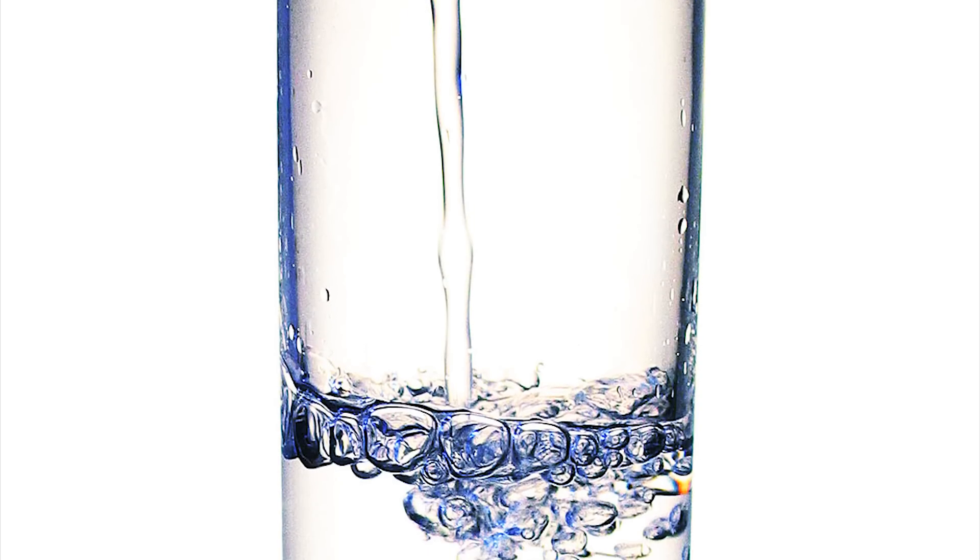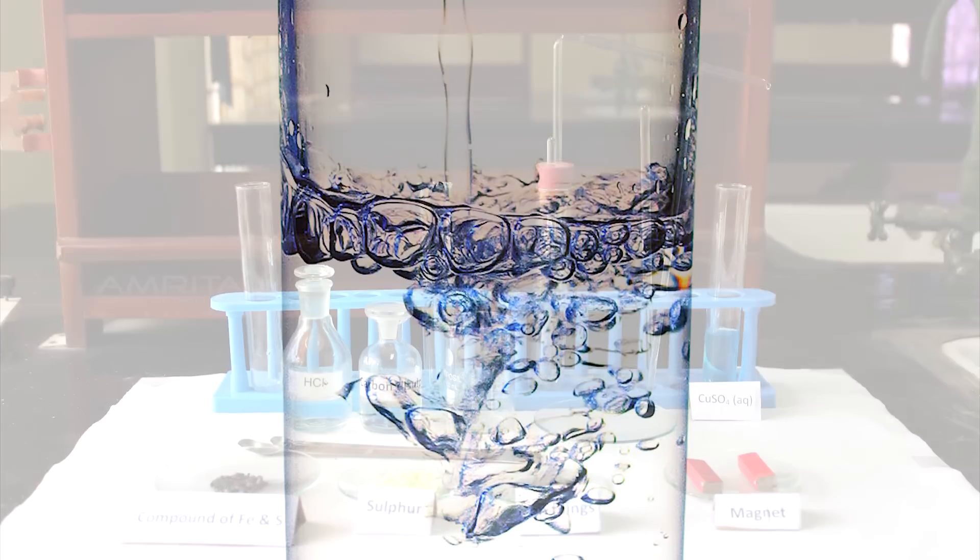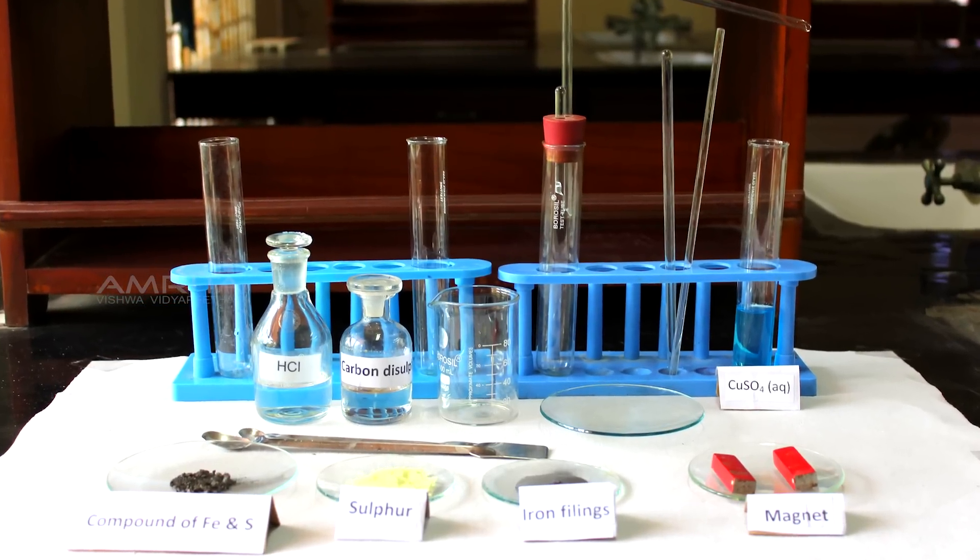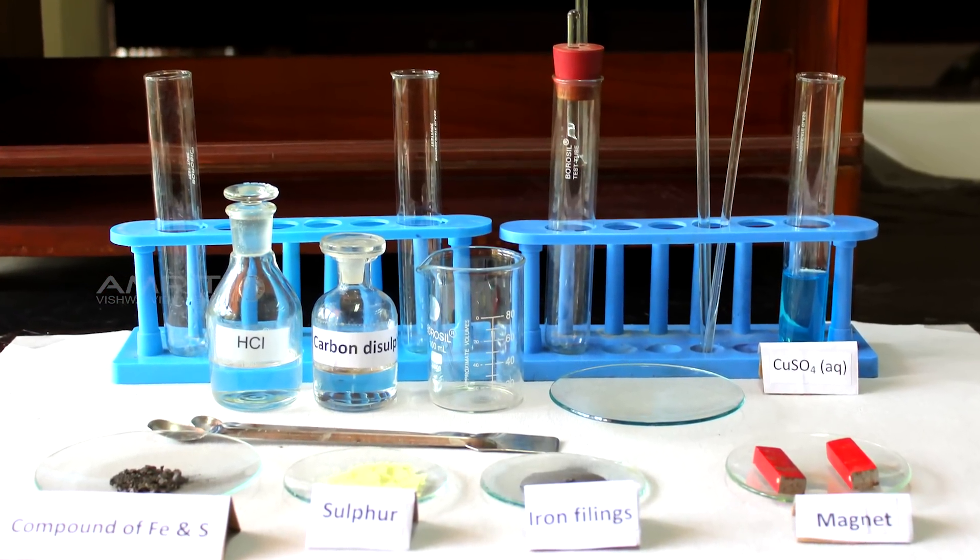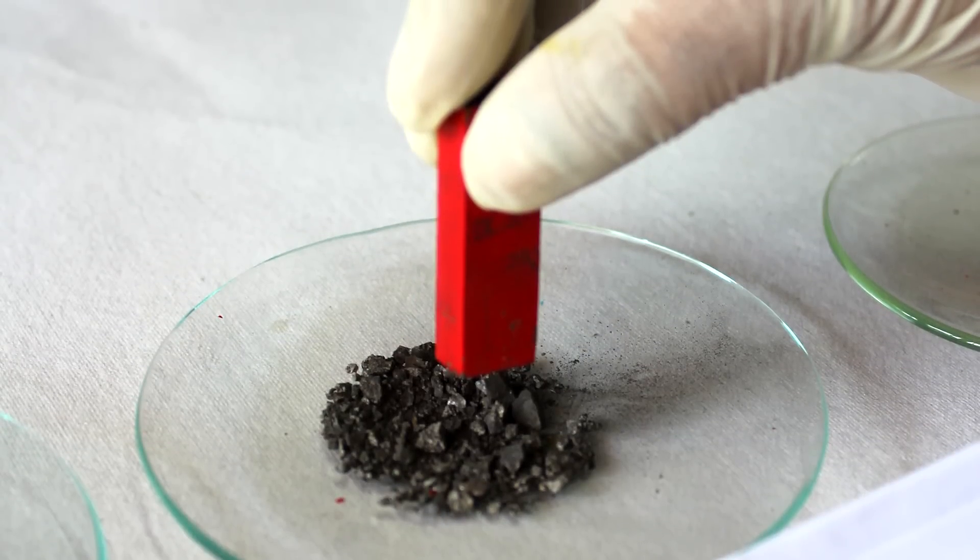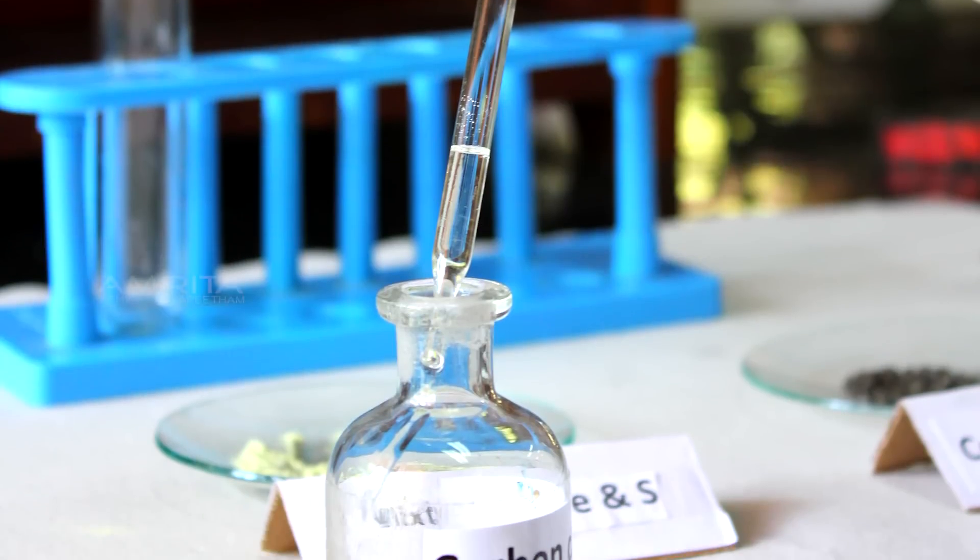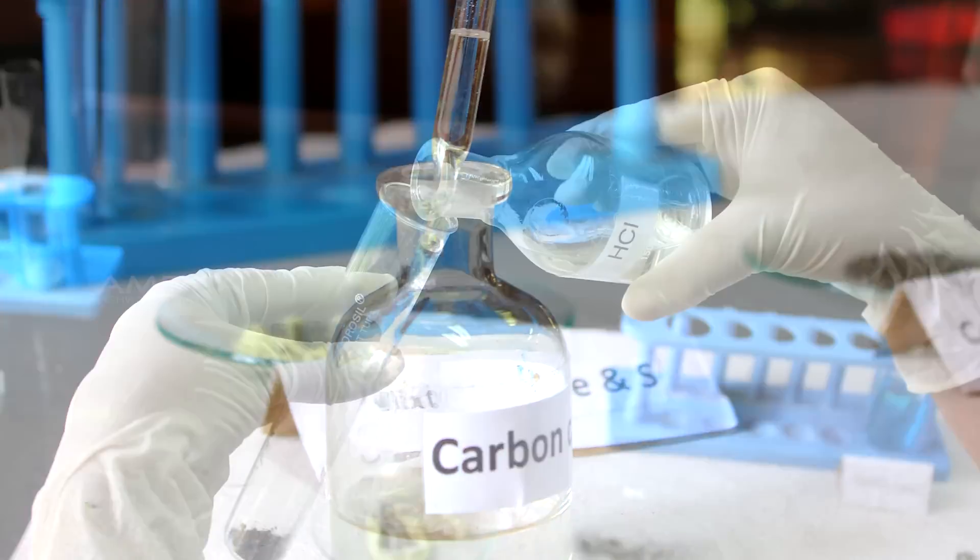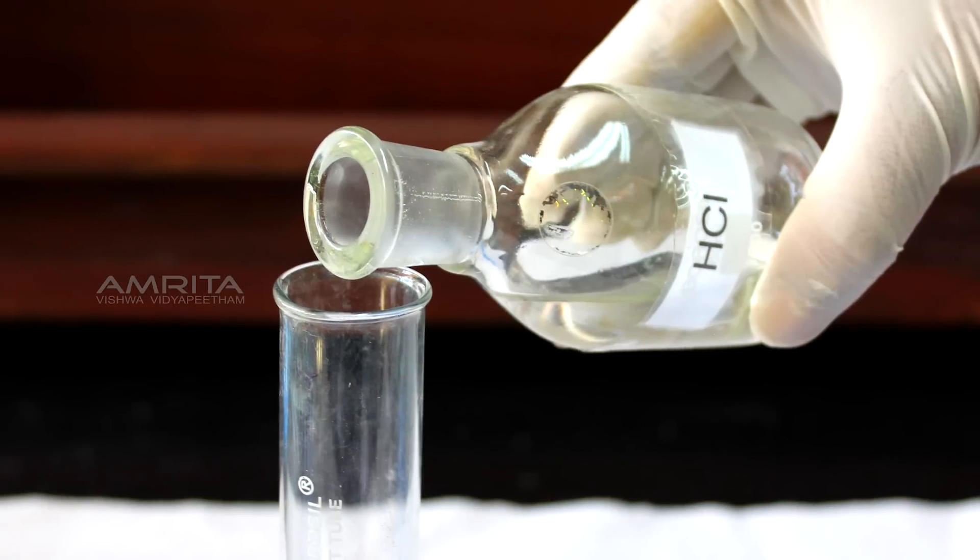Water is a good example of a compound. In this experiment, our aim is to distinguish between mixture and compound on the basis of appearance, behaviour towards a magnet, behaviour towards carbon disulphide and effect of heating with dilute HCl.